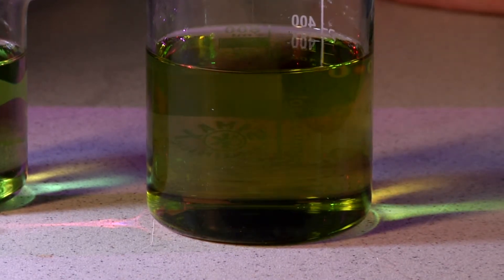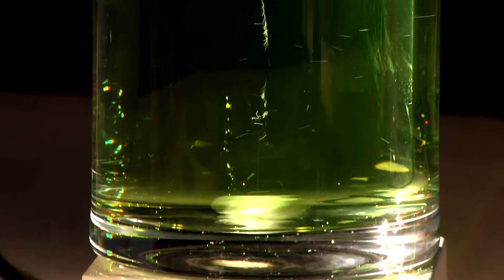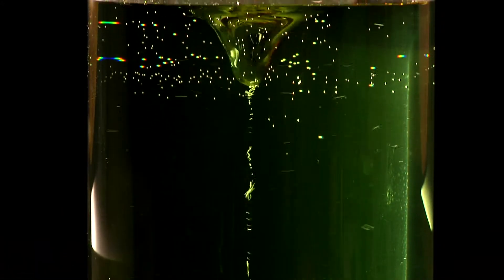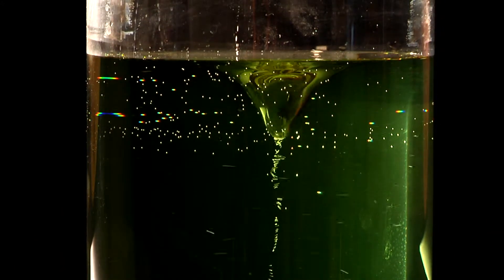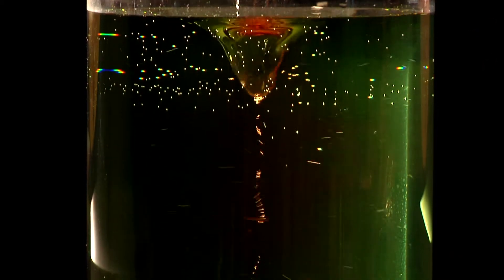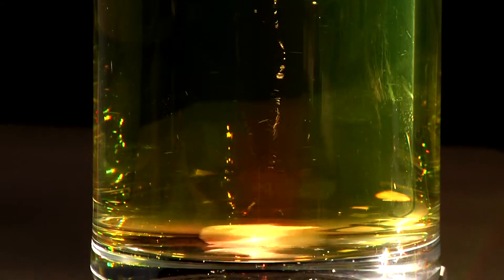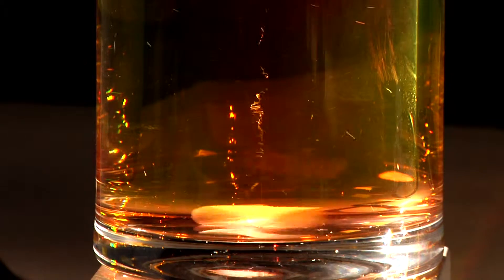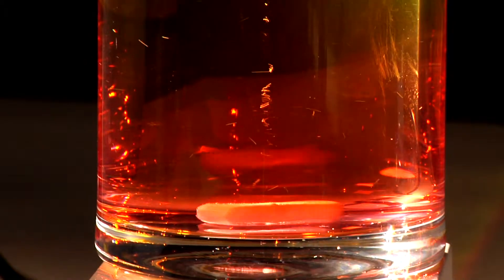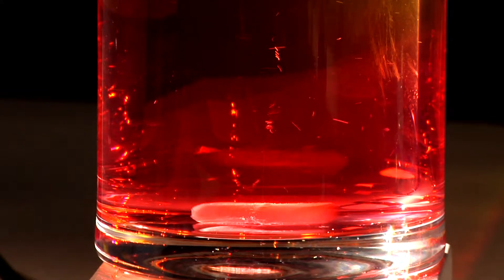Now this gives us an opportunity for some really beautiful chemistry. You don't just get three distinct colours, but a whole rainbow is revealed.